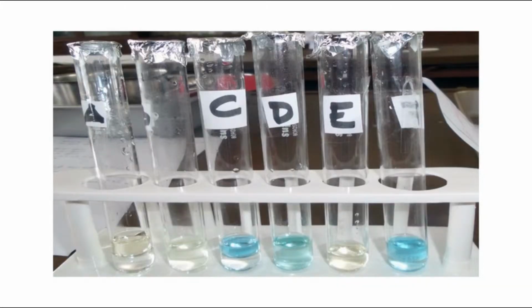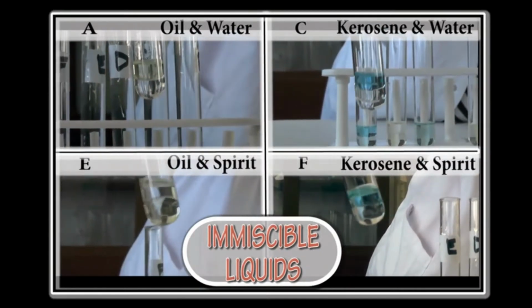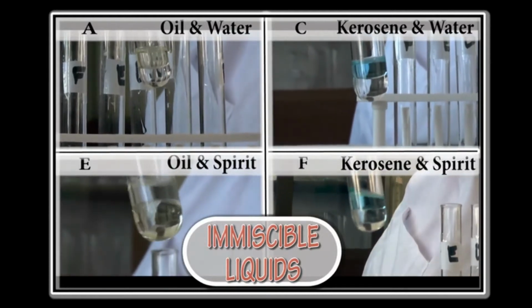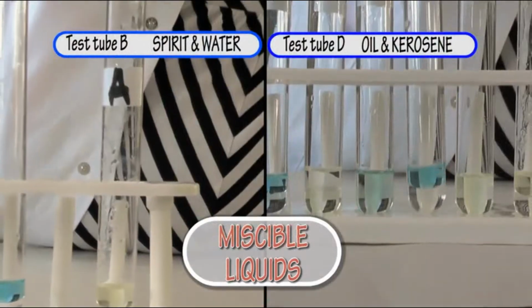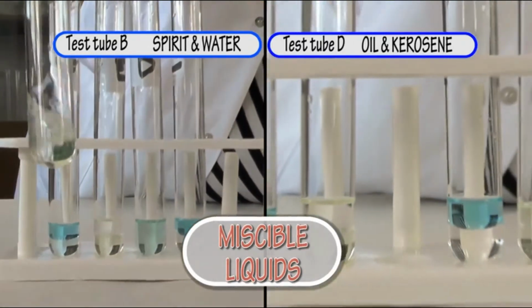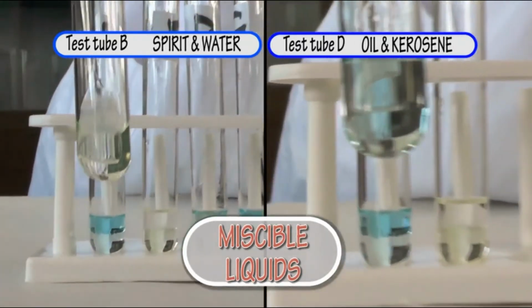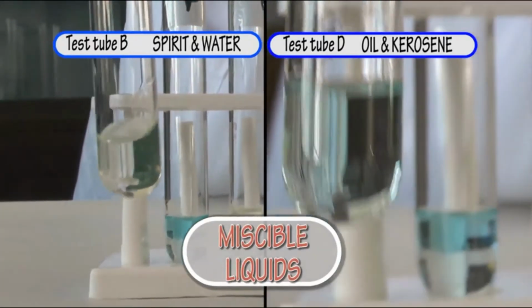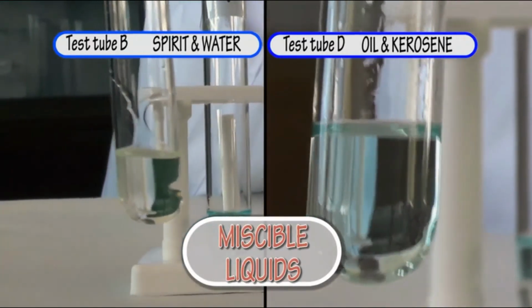The experiment: test tubes A, C, E and F have formed two layers and cannot mix, so they are known to be immiscible. The liquid in test tube B, which contains spirit and water, and in test tube D, which has oil and kerosene, can mix, so they are miscible.